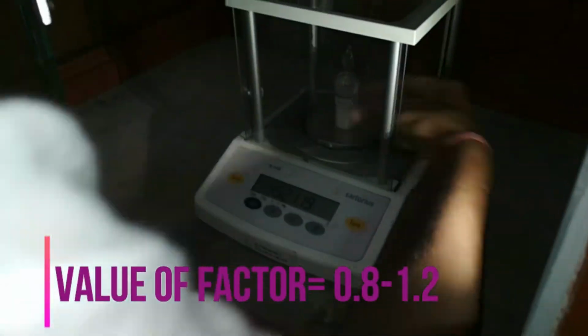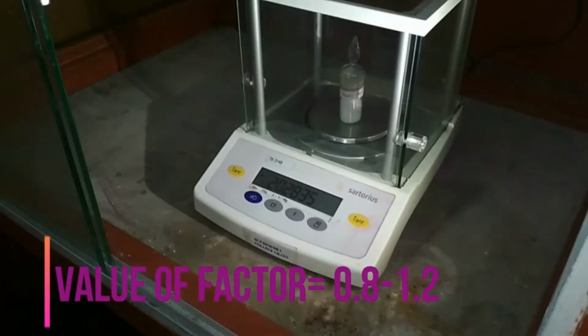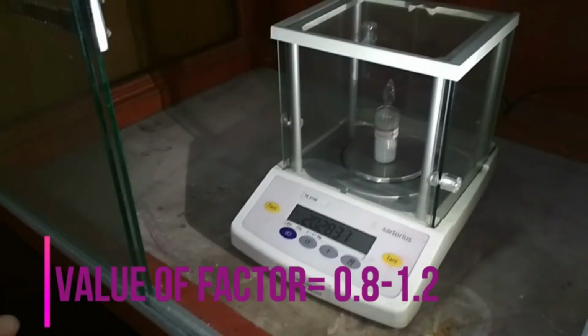and the value of the factor must be in the range 0.8 to 1.2, and that will provide the weight transferred when we subtract the final weight from the initial weight. Here this value is 0.7913, which is very near to our required weight, 0.7875 gram.